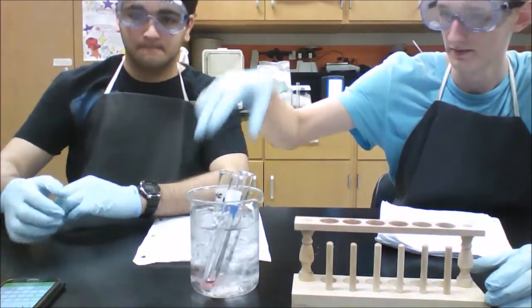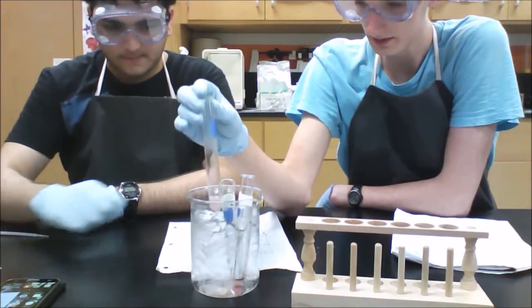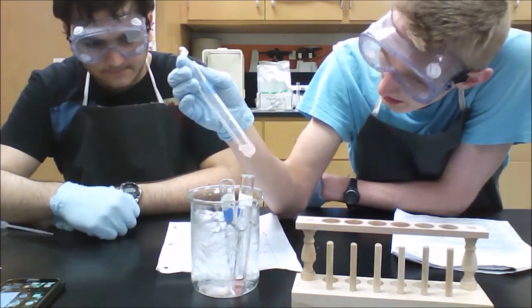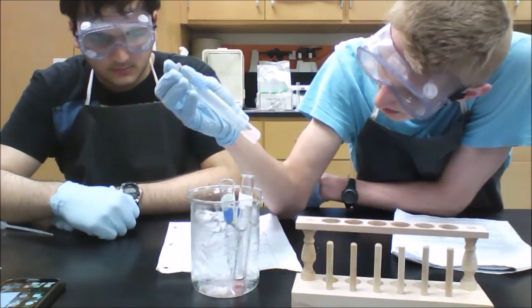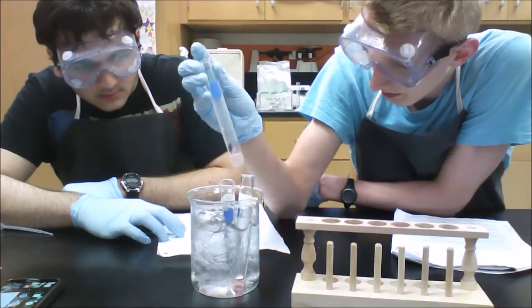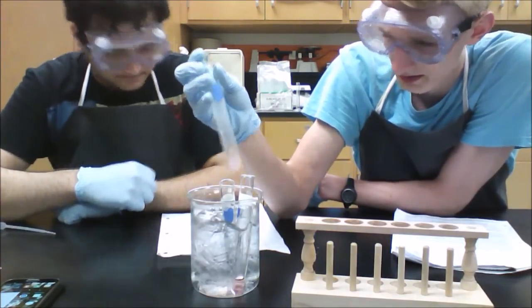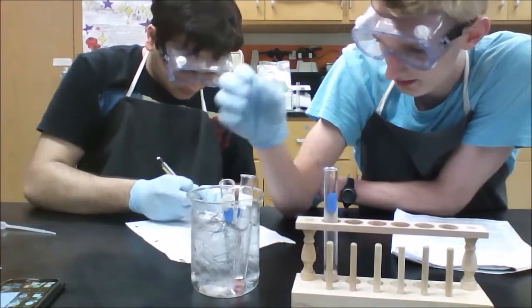For 5 minutes, yes. So we're going to check up on our 3 test tubes to see how much they have changed within the ice bath. We see here with the silver nitrate solution that there are white particles on the bottom, and it has become a little bit more cloudy, but a lighter pink. Yeah, a much brighter pink. Brighter pink, still cloudy.